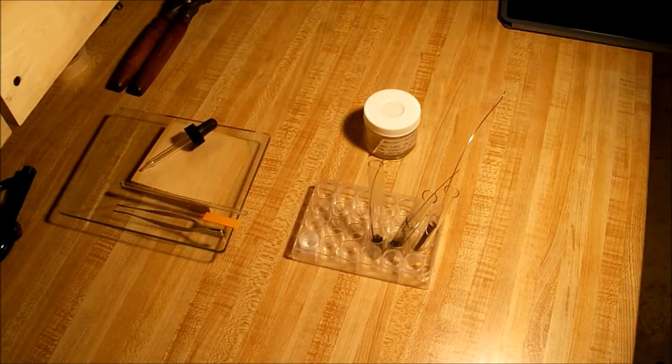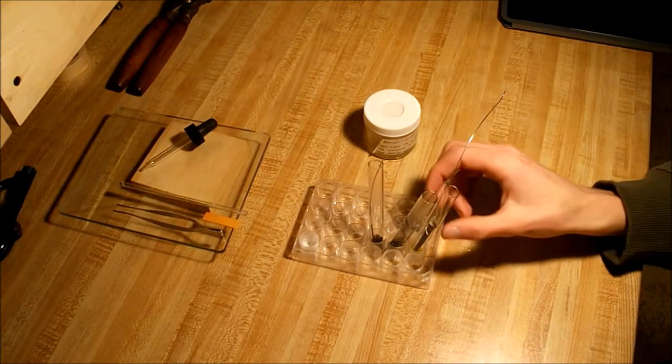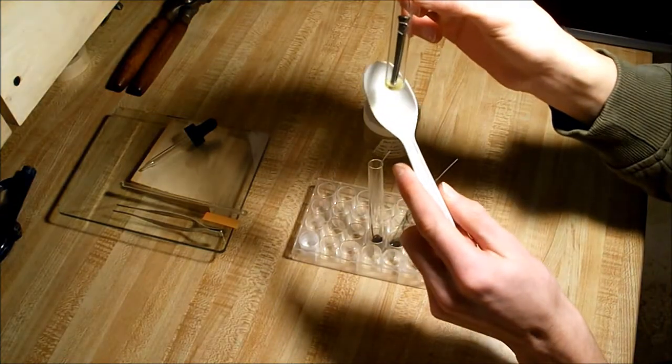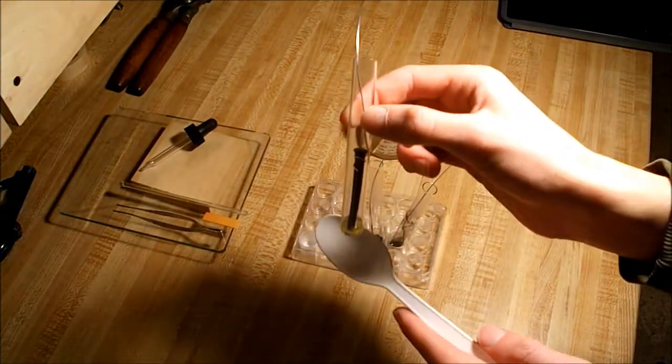Here we are about five minutes later and let's check up on our solutions. The first experiment, the first one we did was making the iron chloride, which as you can see is still fizzing a little bit, but made a nice yellow-green color.